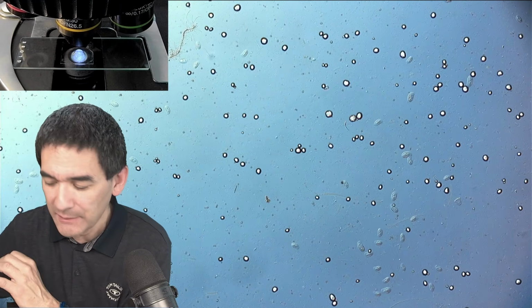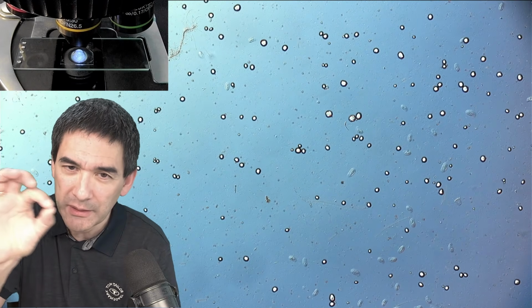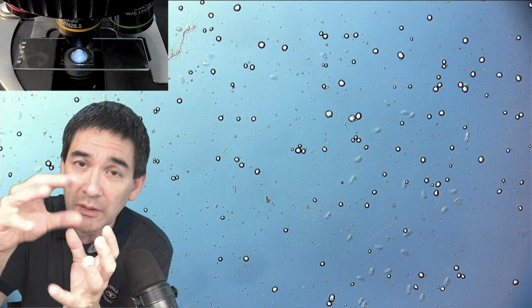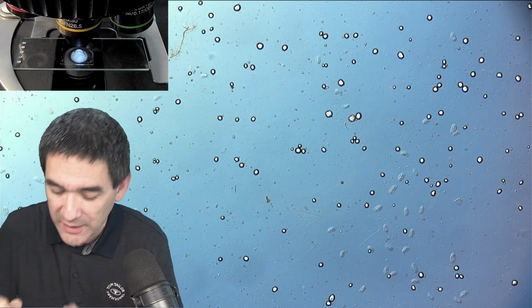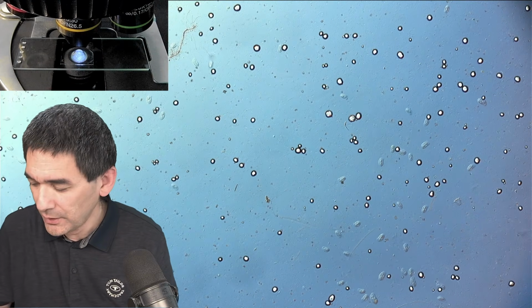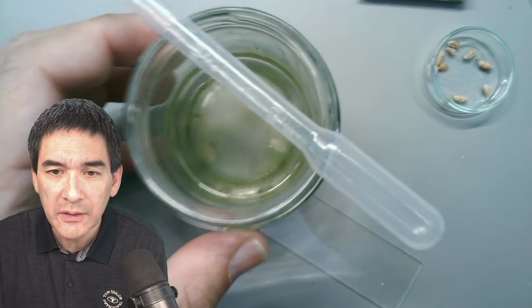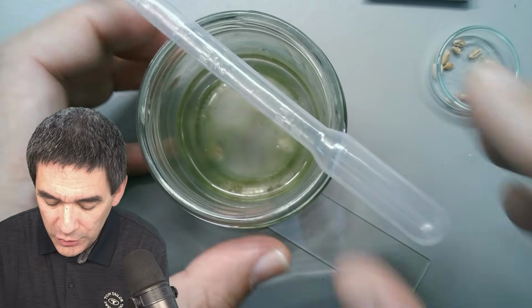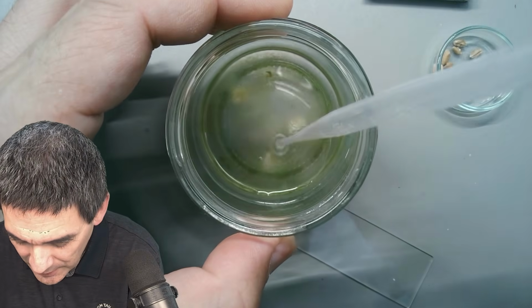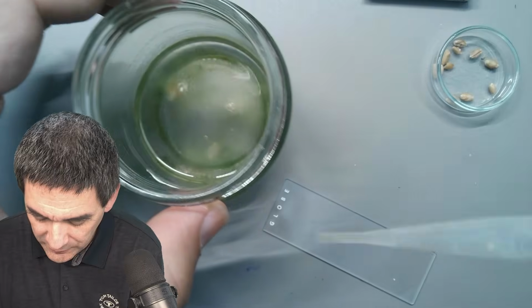The second possibility would be that you do not go all the way to the starch grain, but a little bit around it, so that you're actually pulling off more of the slimy material that's around the wheat grain. Did I say starch grain? So let's try that. I'm going to use another slide, and I have to always refocus a little bit. Maybe not just poke the pipette directly into the grain, but more on the periphery.